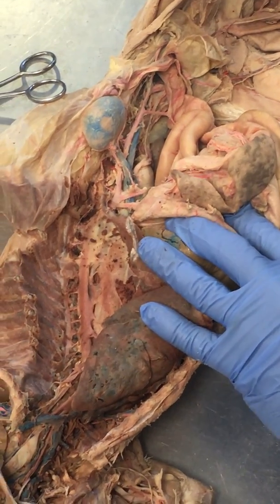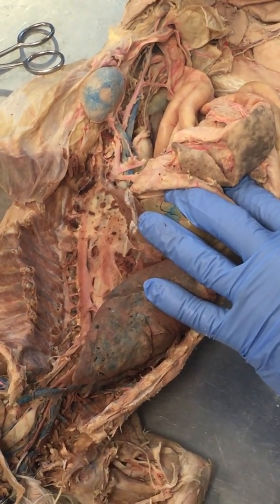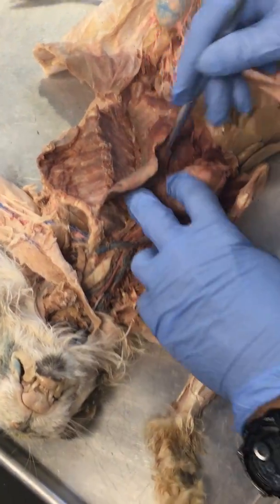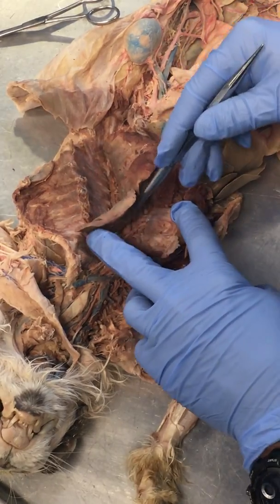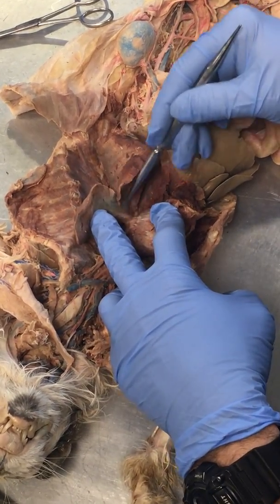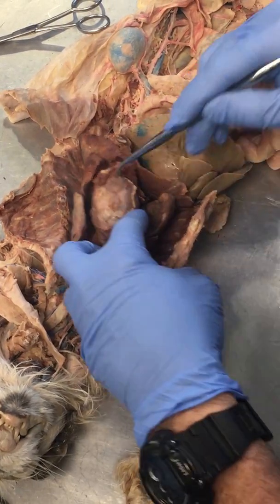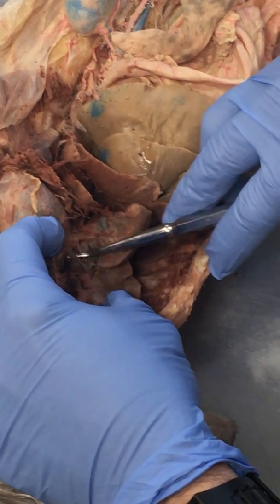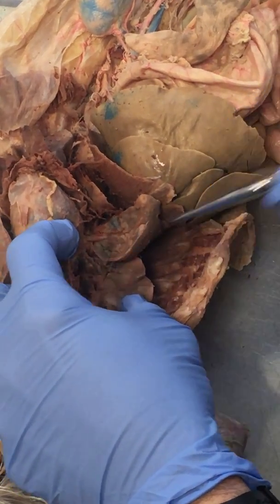So we go to the next thing, pulmonary trunk, pulmonary arteries. I'm not going to ask you to know those. The reason why is because they come directly off of the heart, and then the pulmonary trunk goes upward, but they go into the lungs. So the arteries are going to be here, and then on this side, right down here. And actually there's some here, but we won't test you on them. Those are pretty good. That's some of the better ones I've seen in a while.